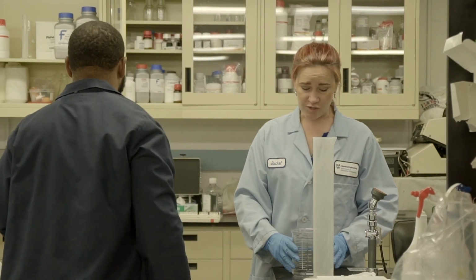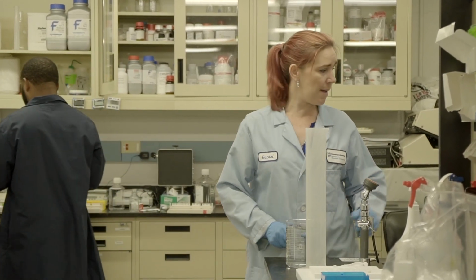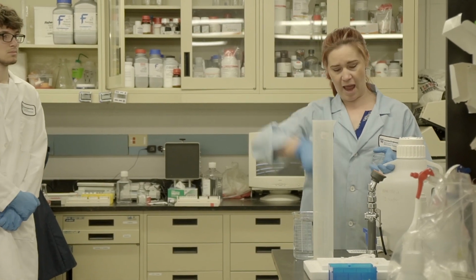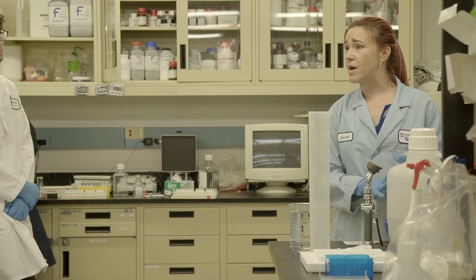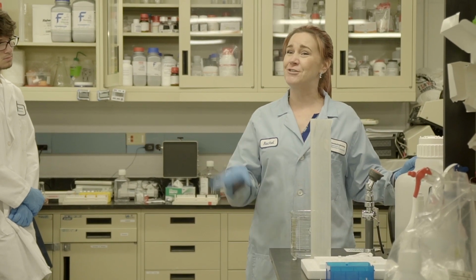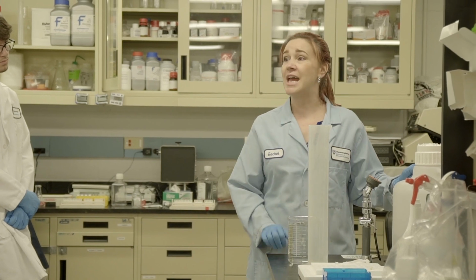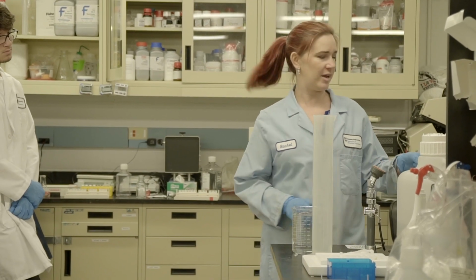Now, when you're in a lab that's running tons of gels, a microbiology lab, they'll often have a big carboy like this or even bigger, where it's already made to 1x. And if you're an intern, your job will probably be making sure that that's full and making a whole bunch. So you'll be making like 10 liters of a 1x solution from your 10x.